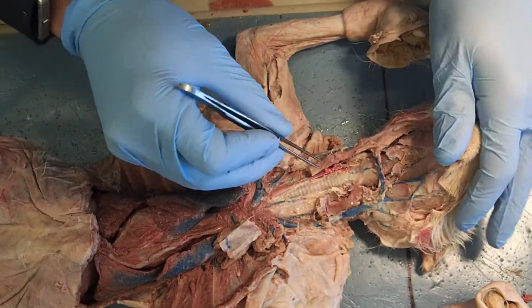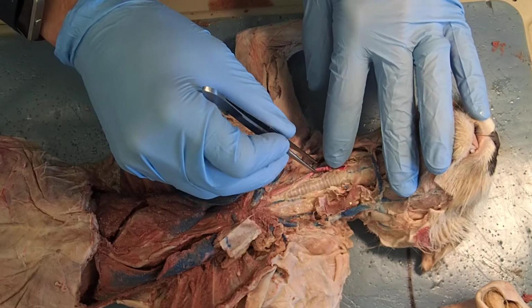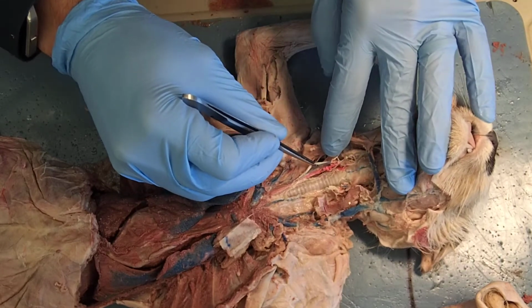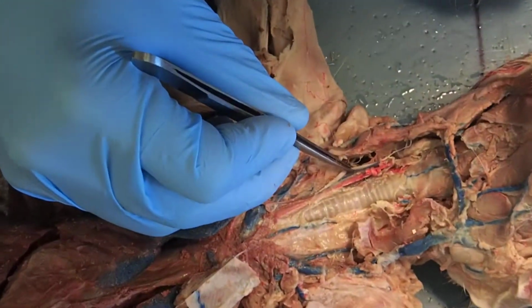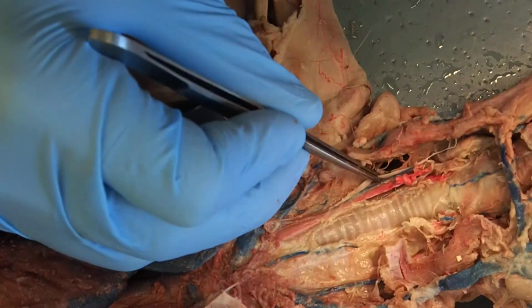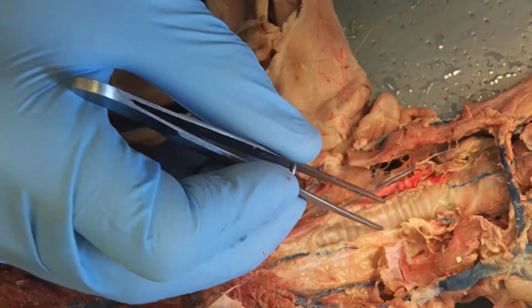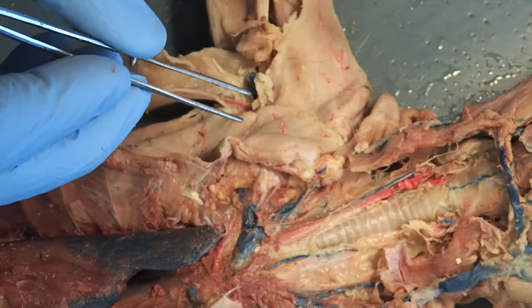Later, we're going to revisit this. We're going to start talking about some of the blood vessels that are within this area. And one thing in particular we will talk about is these white structures. These are going to be some of our nerves. So if we zoom in real quick, you can see some of those structures that I'm talking about. Here's the nerves, here's a blood vessel, here's the trachea. Okay? So let's zoom back out for a little bit.